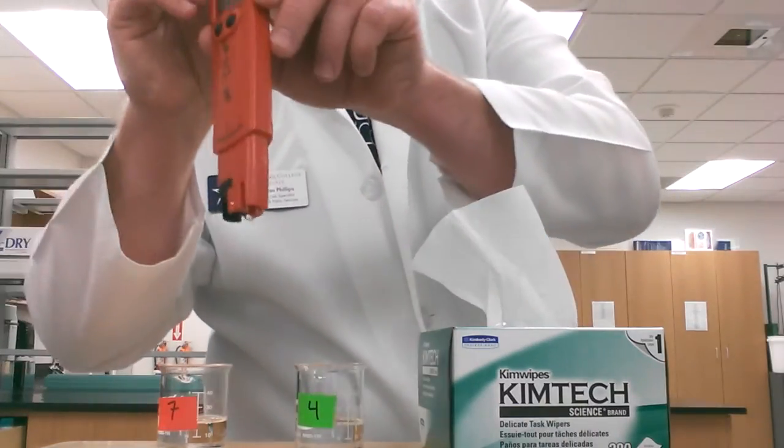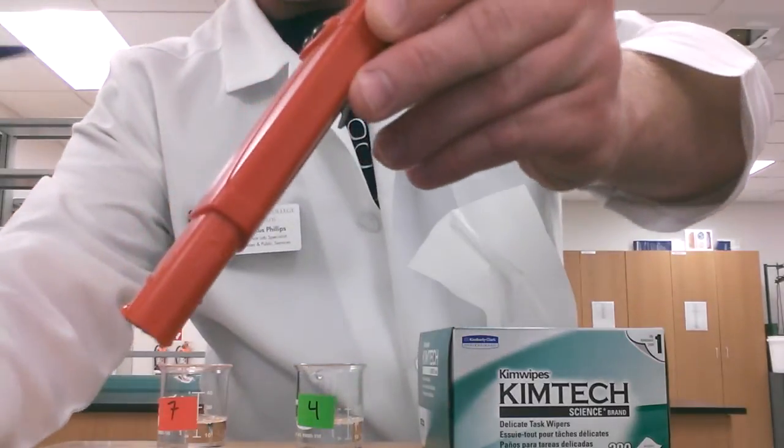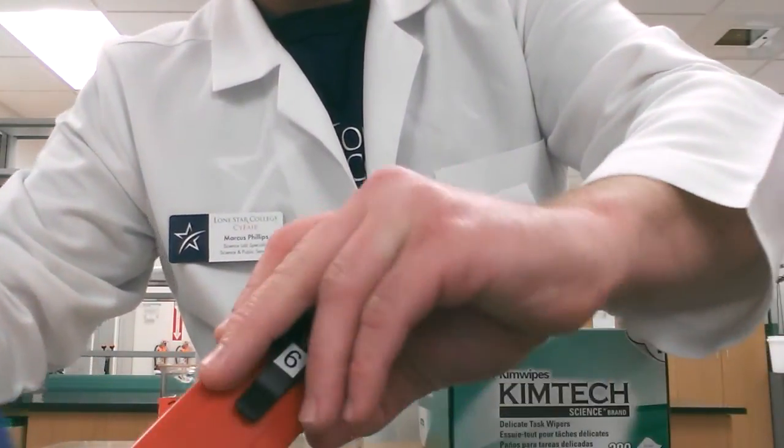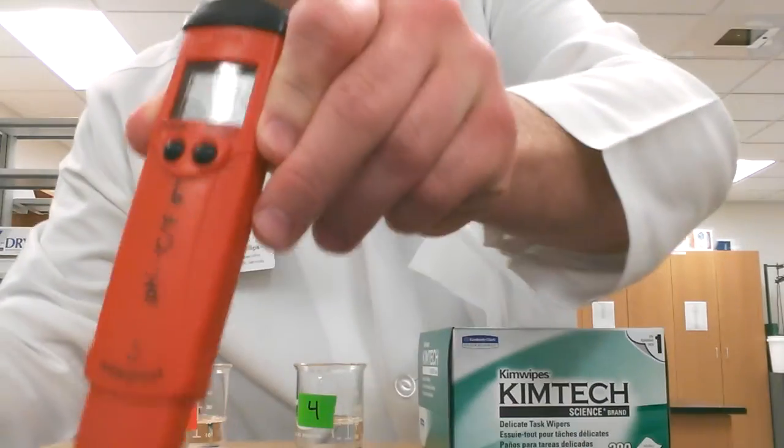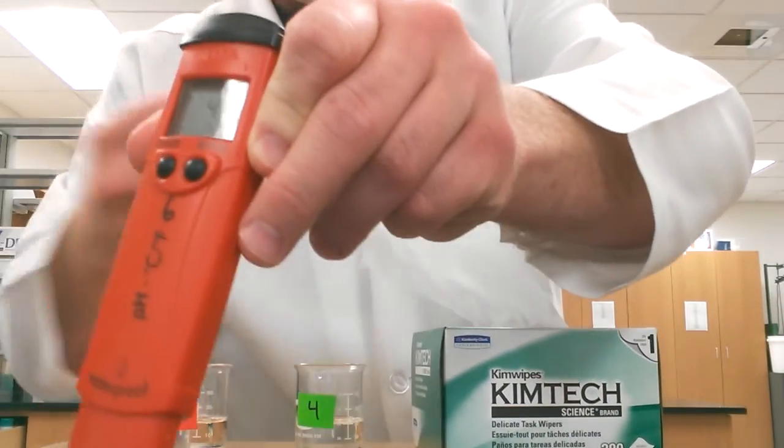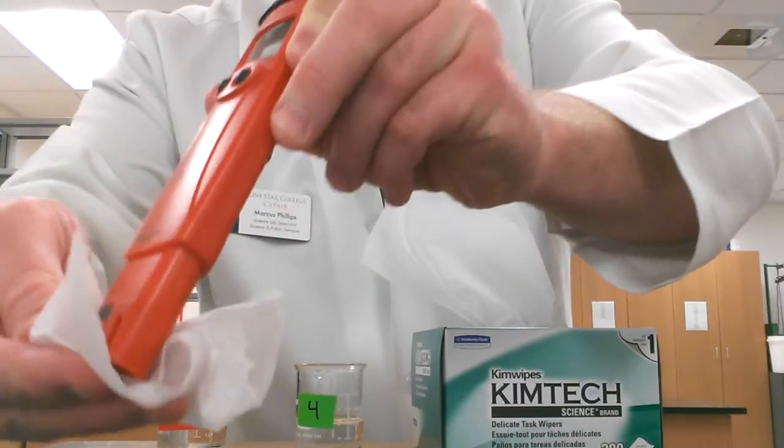Once we take it out of the pH 4 solution, we're going to rinse it off. And at this point, after you've dried it, you can use it.